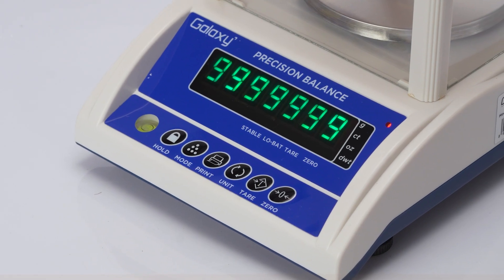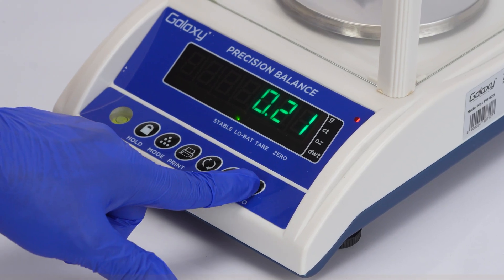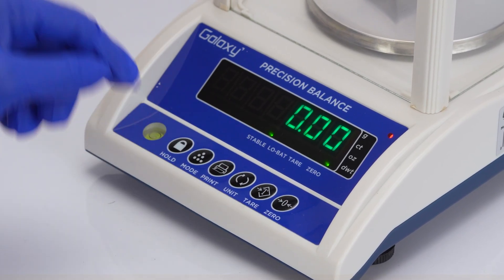Press the on-off switch to turn on the balance. If the display does not show 0.00, press zero to reset it.